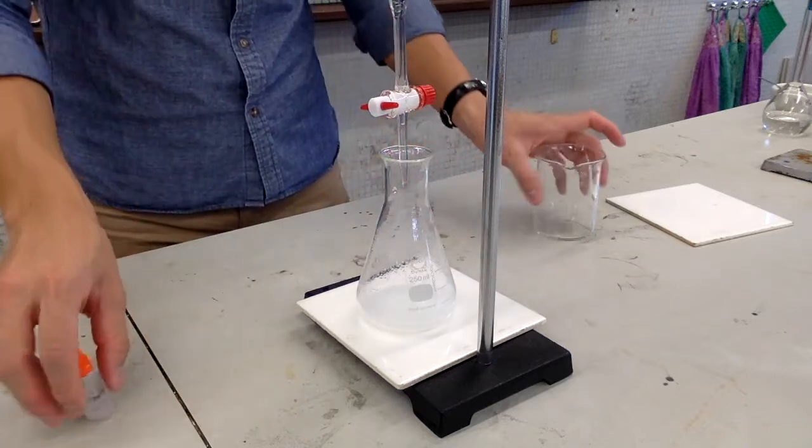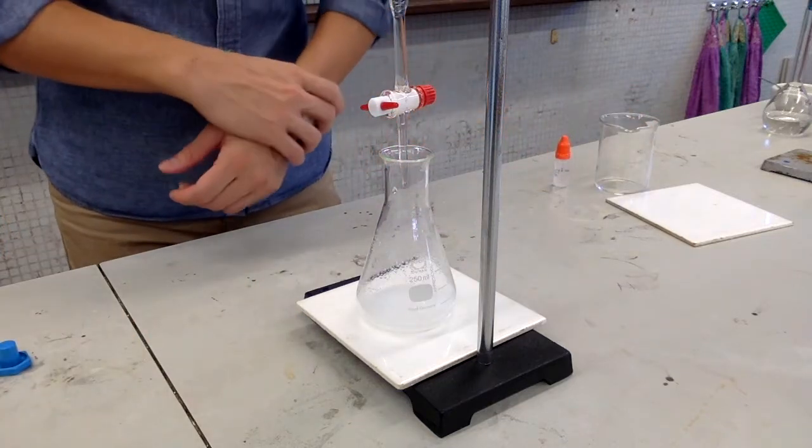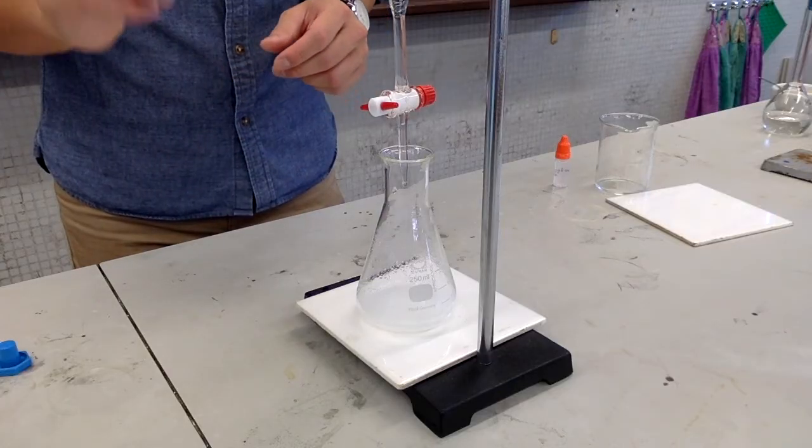Perform titration. The endpoint should be indicated by a faint pink color.